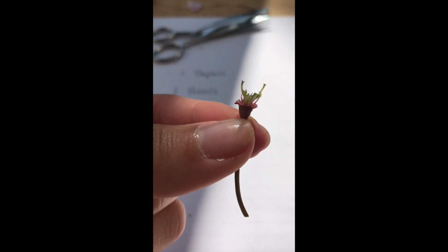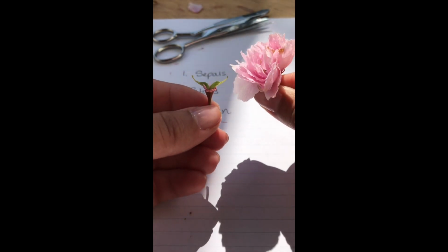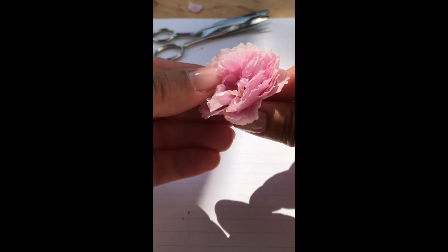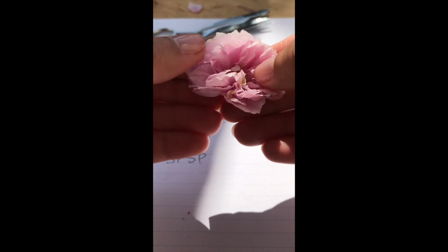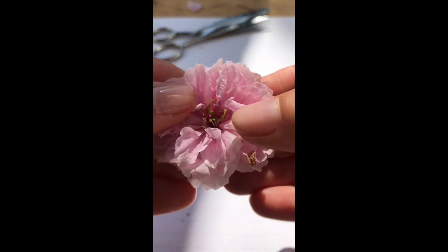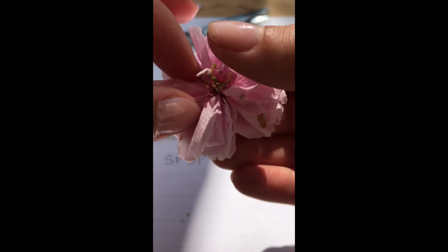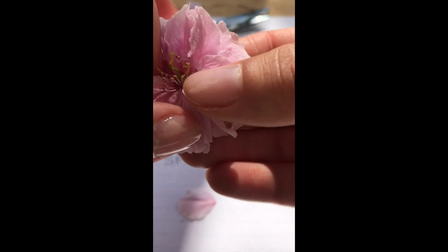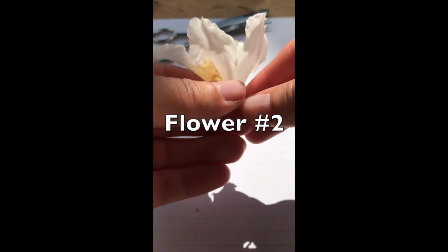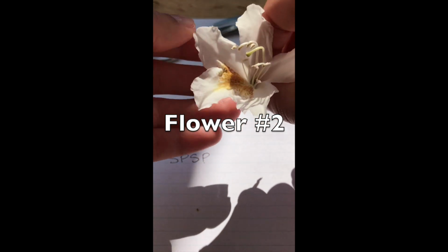So those pistils are really hidden inside the flower. If you remember what the flower looked like when we started, here's one that I haven't taken apart yet. Look at all of those petals that have to be moved to the side in order for those pistils and for the stamens, both of those reproductive organs, to show. So this flower is sort of interesting, and it's a good example of how not all flower parts are always going to look the same.